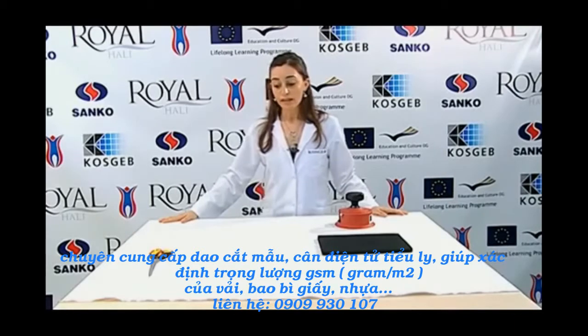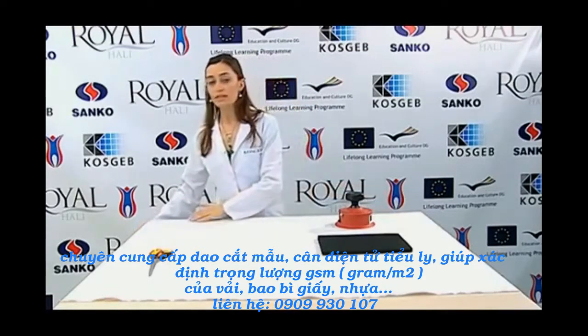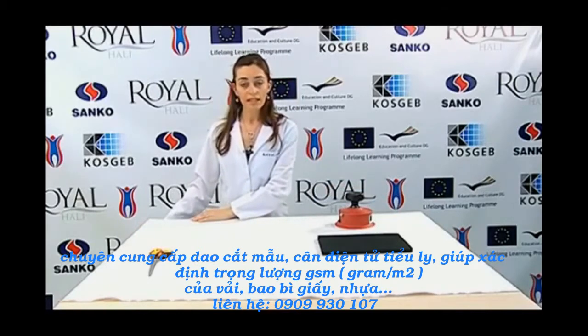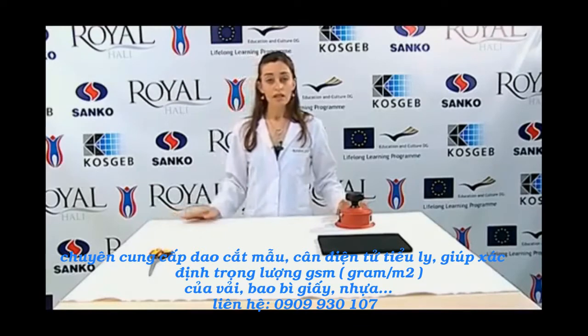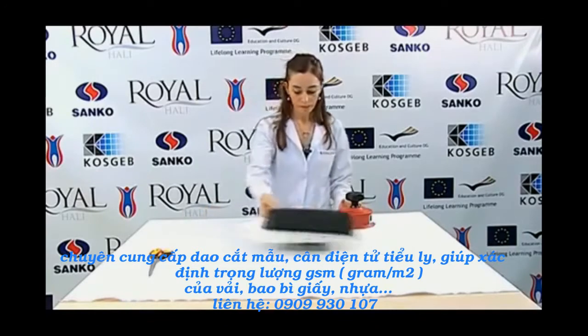When taking the samples, attention should be paid in order not to take the samples from parts close to the edges. At least a 15 centimeter space should be left from the edges. Moreover, samples should not be taken from places where there are wrinkles and fold traces.